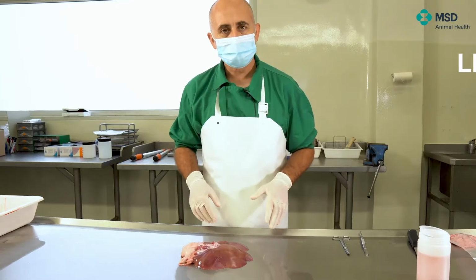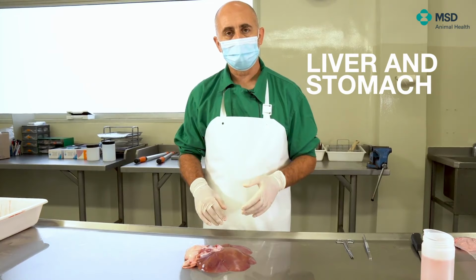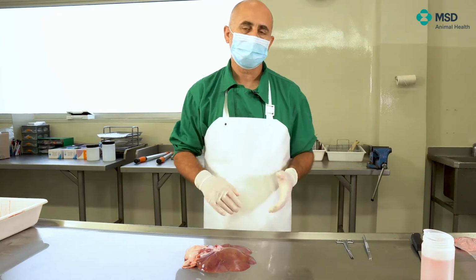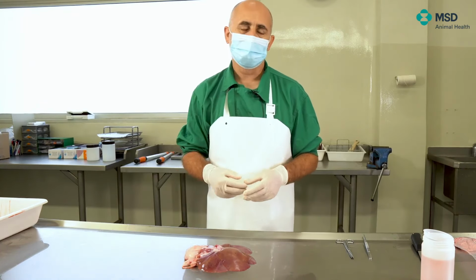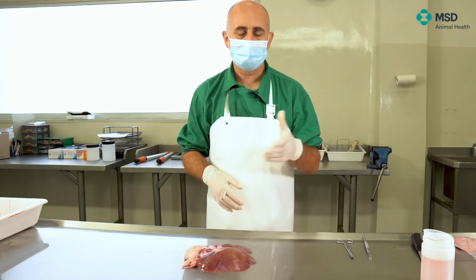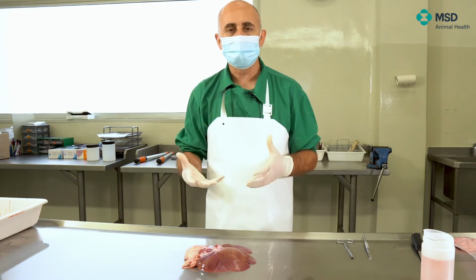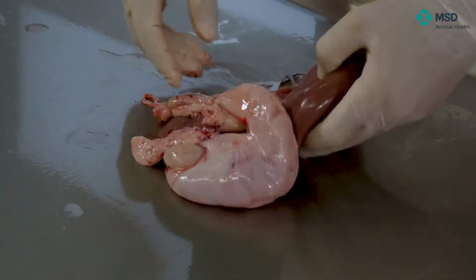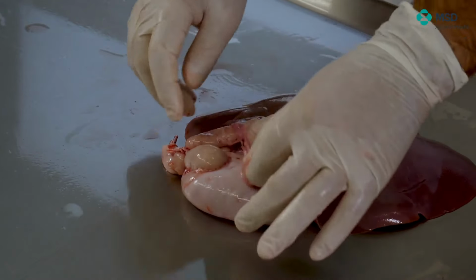Now we will study the stomach and the liver. In fact, as you have seen before, we take them out together, basically because this is inherited from small animals, especially in terms of the flow of the bile from the gallbladder to the duodenum. And sometimes, even in pig, this is not so important. In certain specific situations, it could be. So what we want to do here is to be sure that this flow is correct.